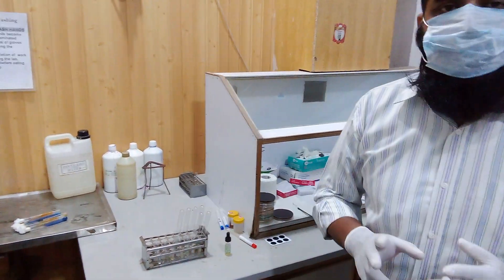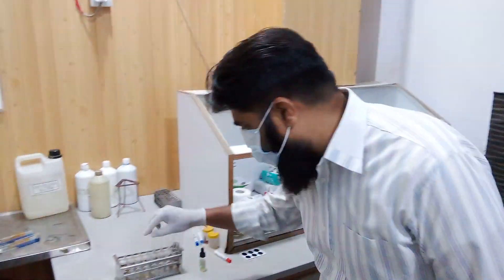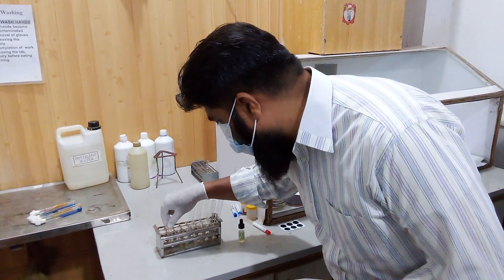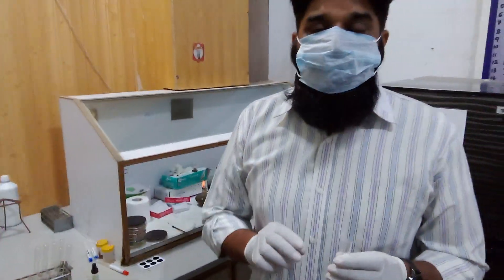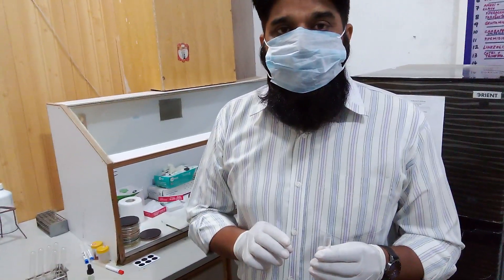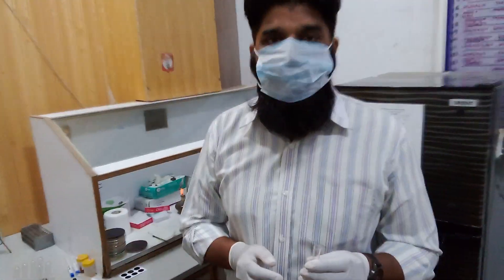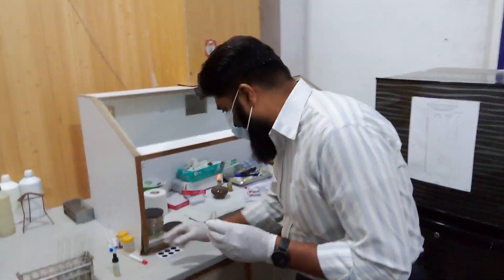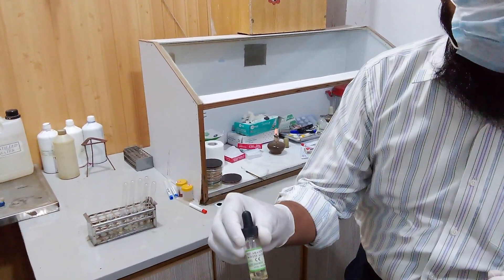There are two methods for the performance of the coagulase test. One is the glass slide method and the second is the test tube method. We are going to perform the test tube method. In a simple test tube, students, we will take bovine albumin.